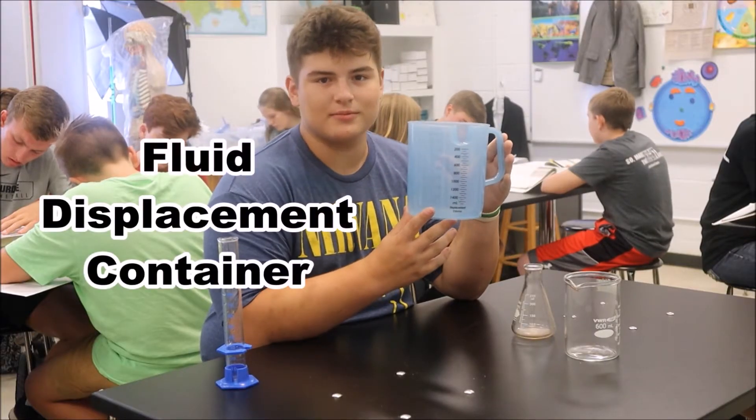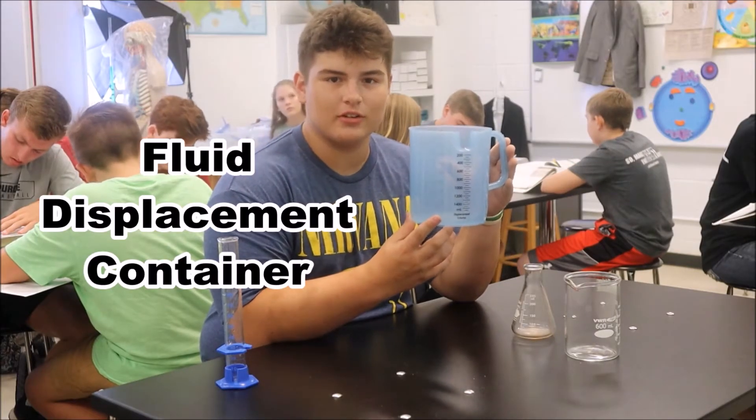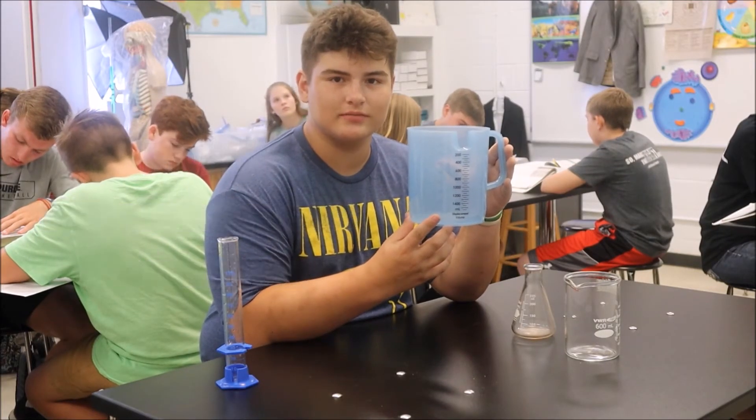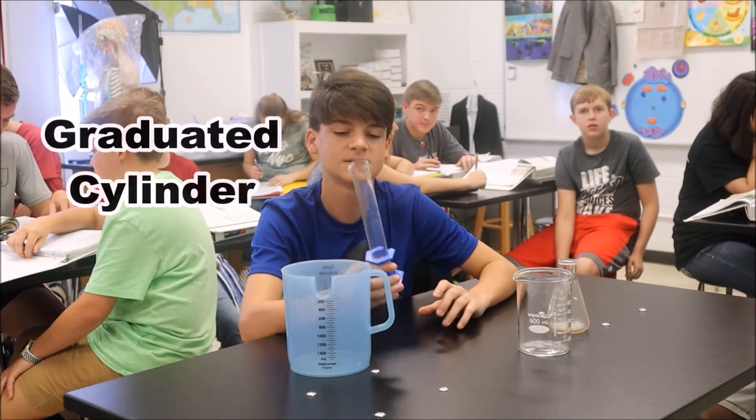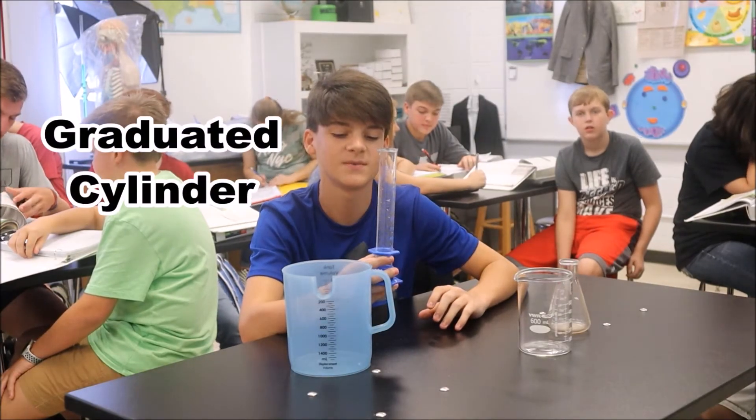This is a fluid displacement container. It is used for measuring volume in solids. This is a graduated cylinder. It's used to measure volume in liquids.